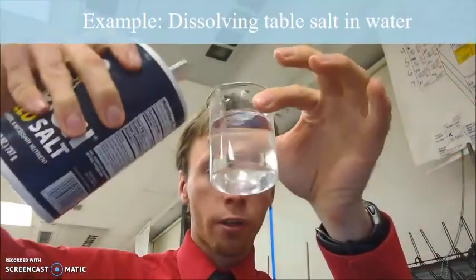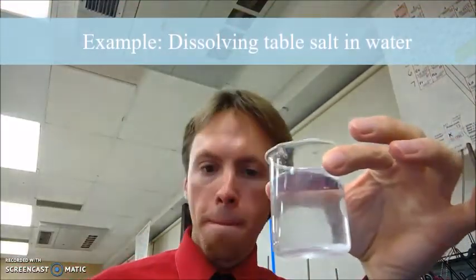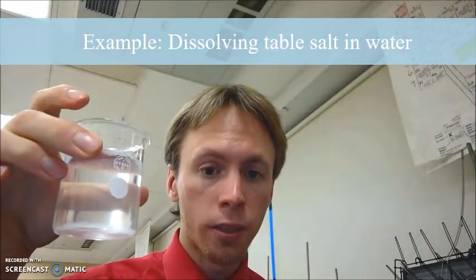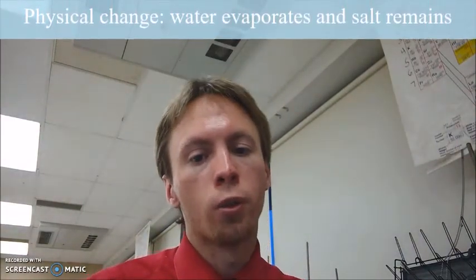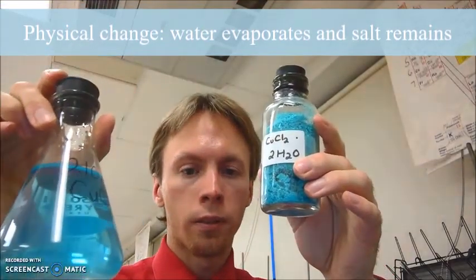Even when you dissolve things too, for example, I have salt and water here. It may look like the salt disappears, but there's still fundamentally salt and still fundamentally water. I could taste it if I were to drink this and note that the water tastes different with the salt in it than it does without the salt. And if I were to leave that out for a while, eventually all the water would evaporate and have salt left over. Here's a chemical where we have an example of a solid and a mixture.